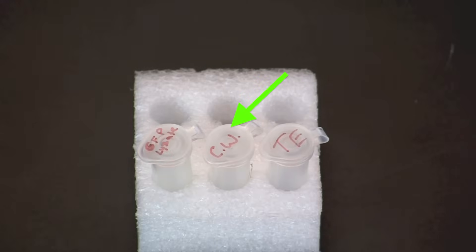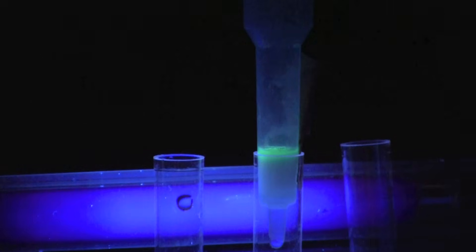Next, add 250 microliters of column wash buffer. Wash buffer is a medium salt solution. Allow the buffer to drain until the bottom of the meniscus is one to two millimeters from the surface of the resin.